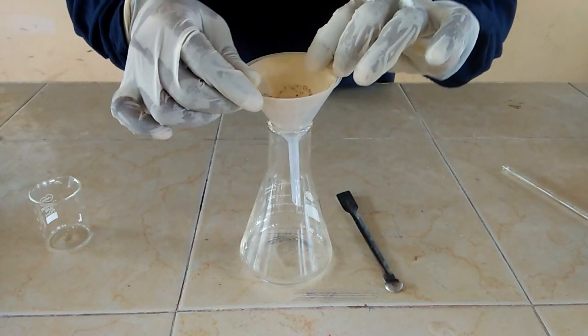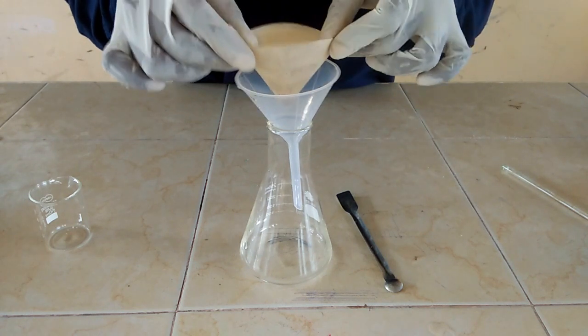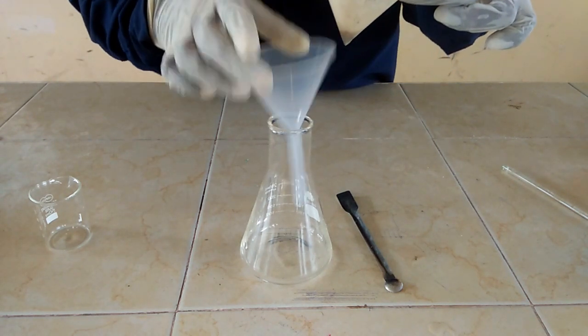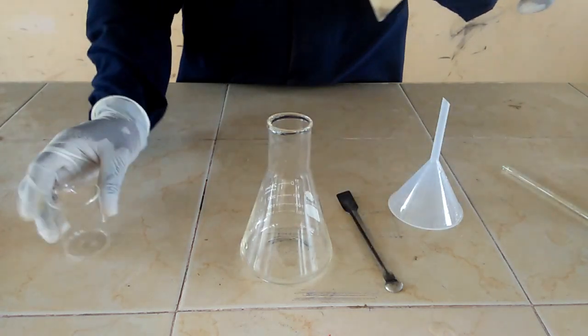So after some time, we have already filtered our mixture. Let us see what has developed. We will see what we have been able to do.